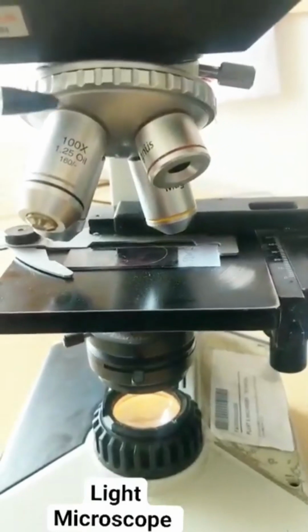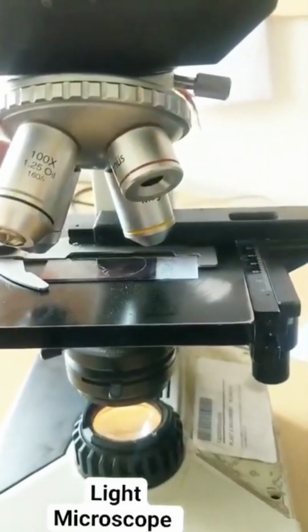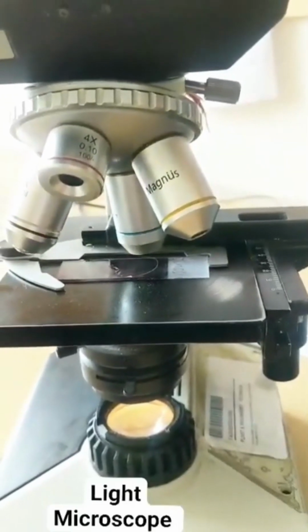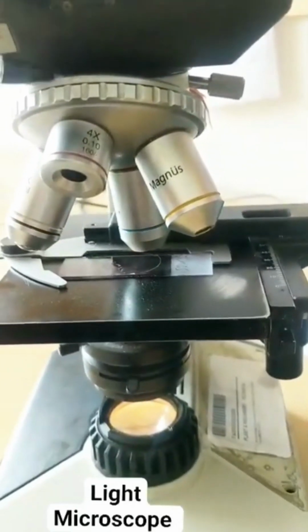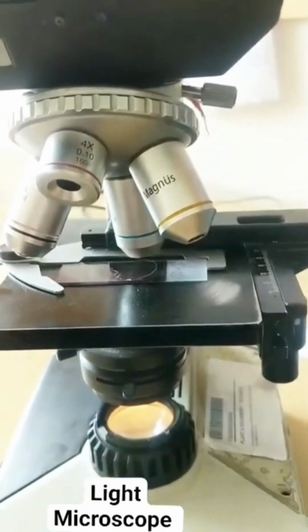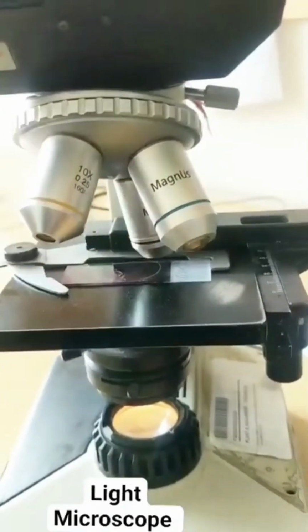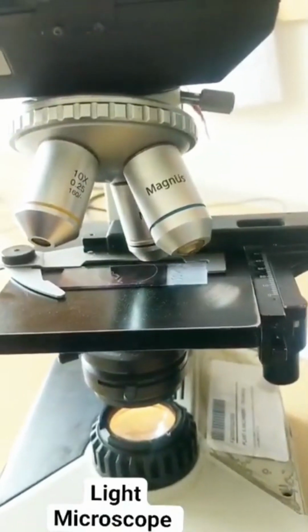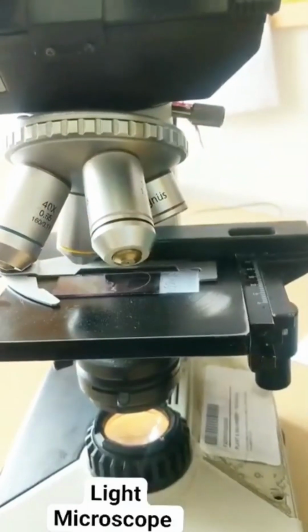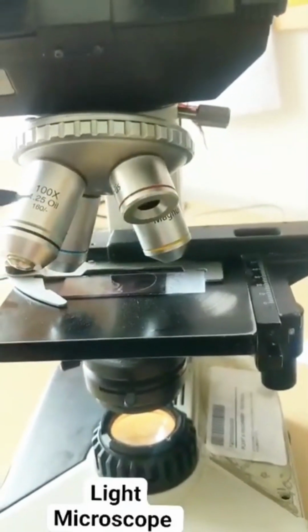What are the first set of lenses that you have? You notice this set of 4 lenses. These are the objective lenses. So let's see what's written on them. On this objective lens, this tiny lens, you have 4x. So this is 4x magnification. The next one you have 10x. Further, you have 40x written. And lastly, you have 100x written.